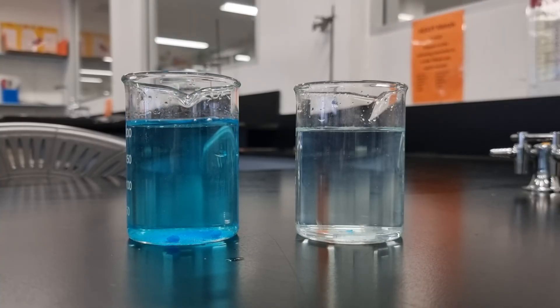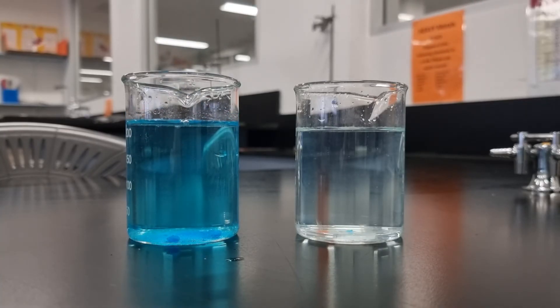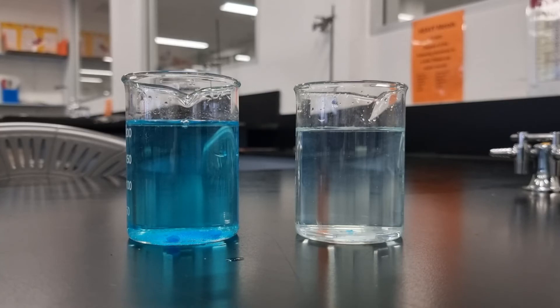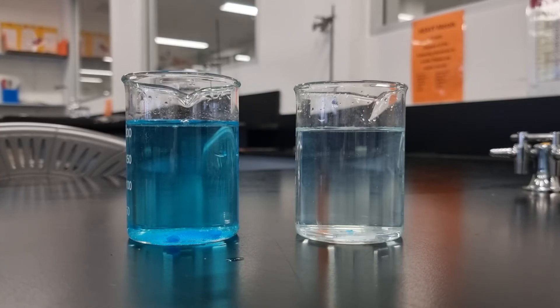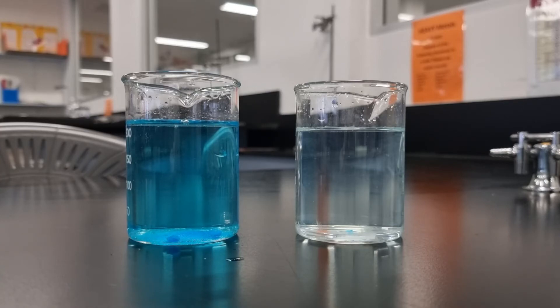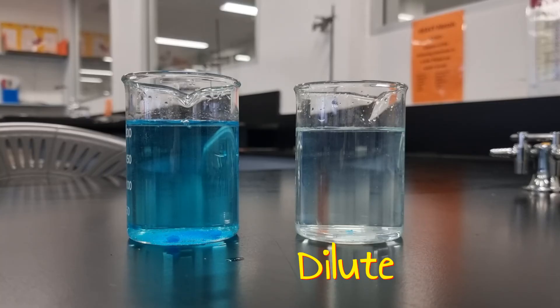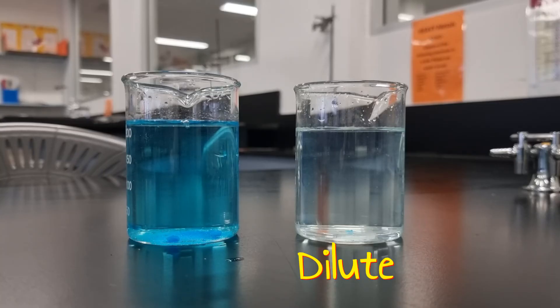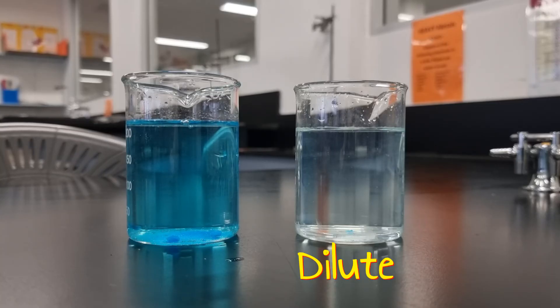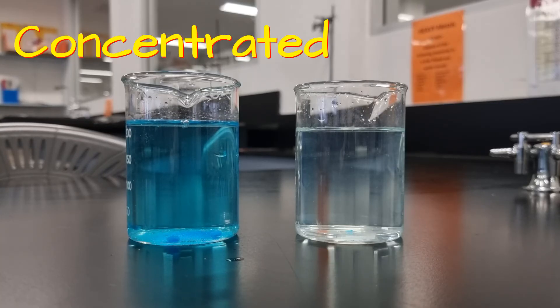I had much more copper sulfate, more dissolved into solution, and so I see a much more intense blue colour of the solution. On the right we have a dilute solution; on the left we have a concentrated solution.